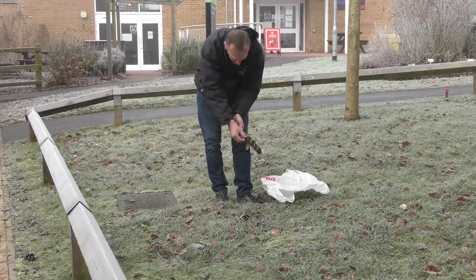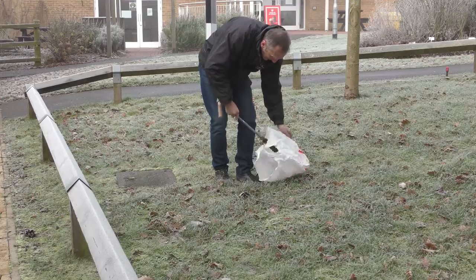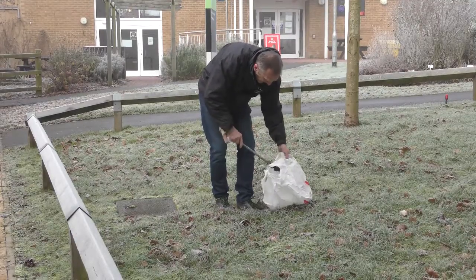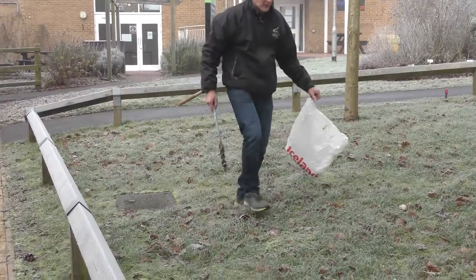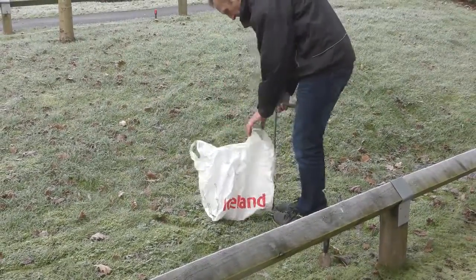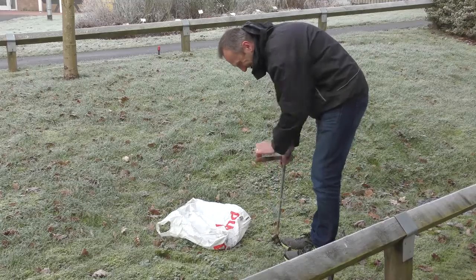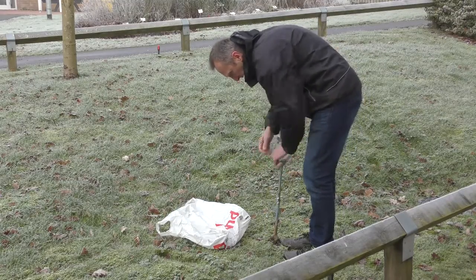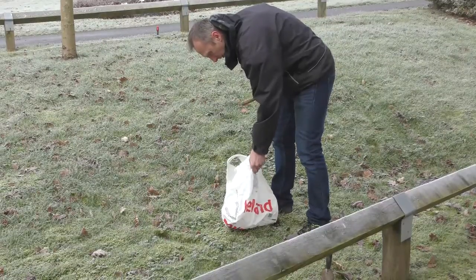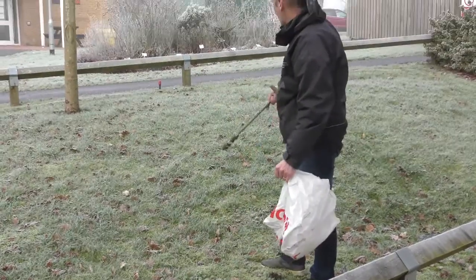Pull it out, remove the organic matter — we don't need that — then knock the soil up into the bag. Carry on going, heading for the little marker: one, two, three, four, bounce, hit back towards another marker, five — take a sample and pop it in the bag.